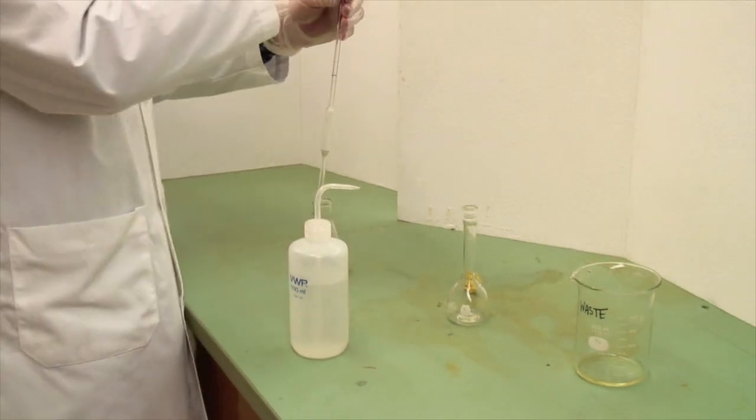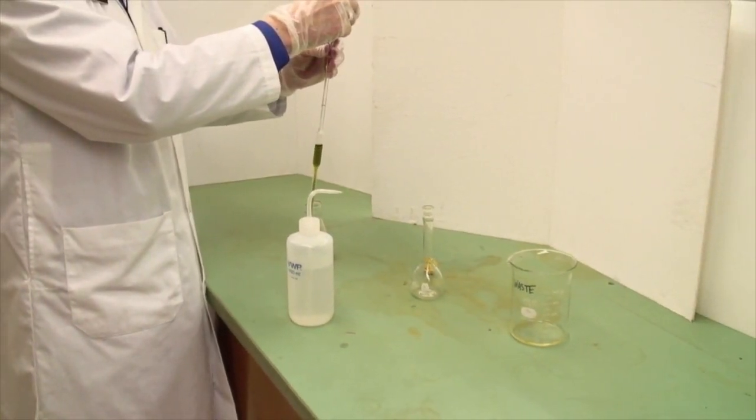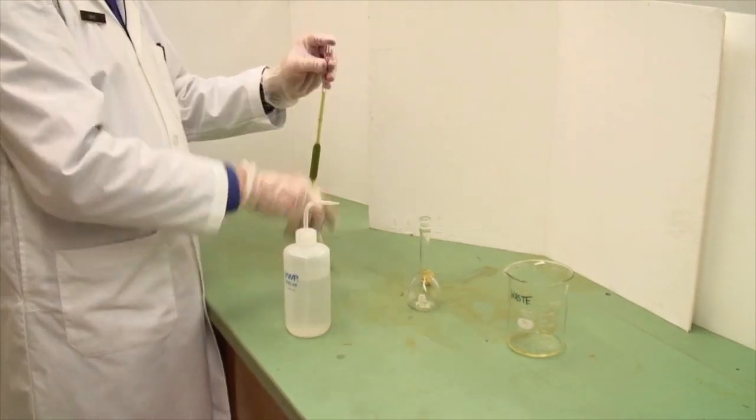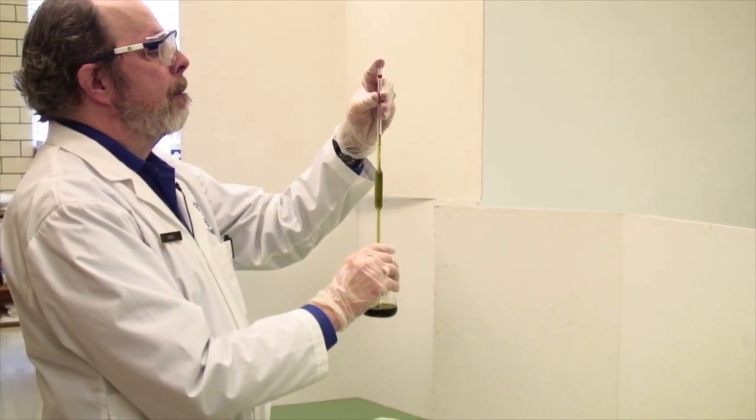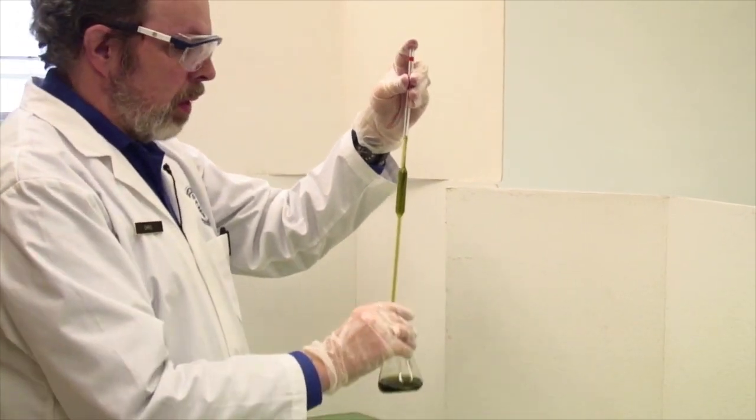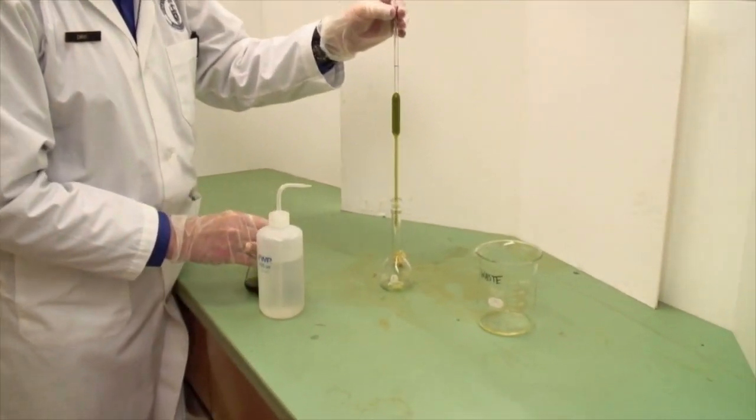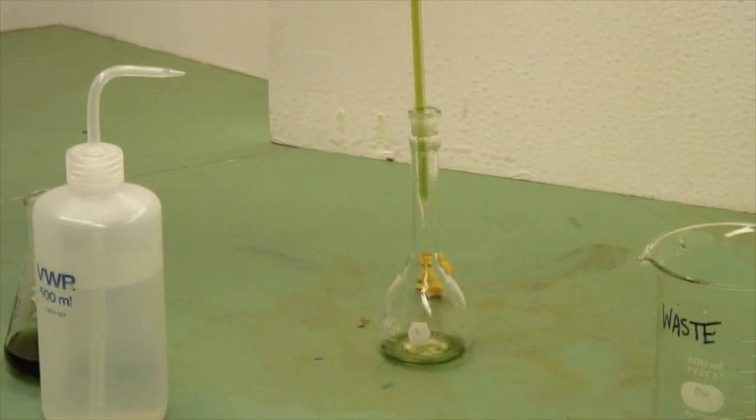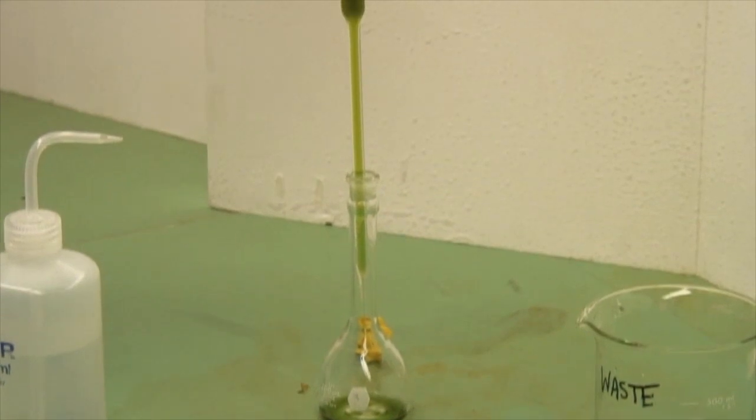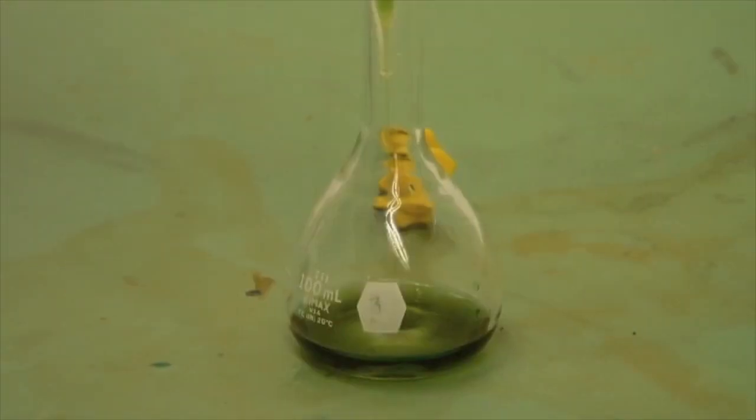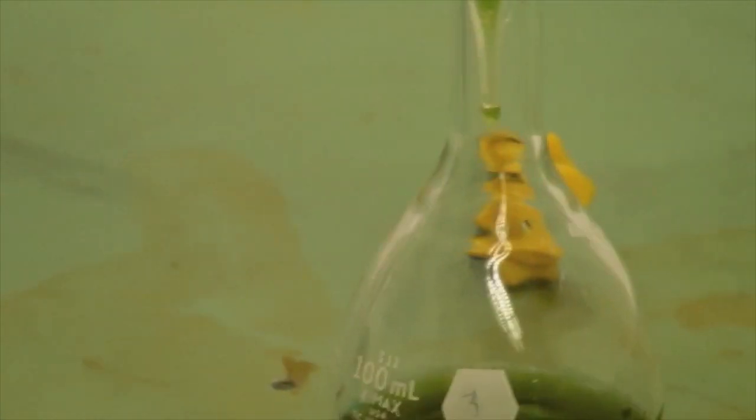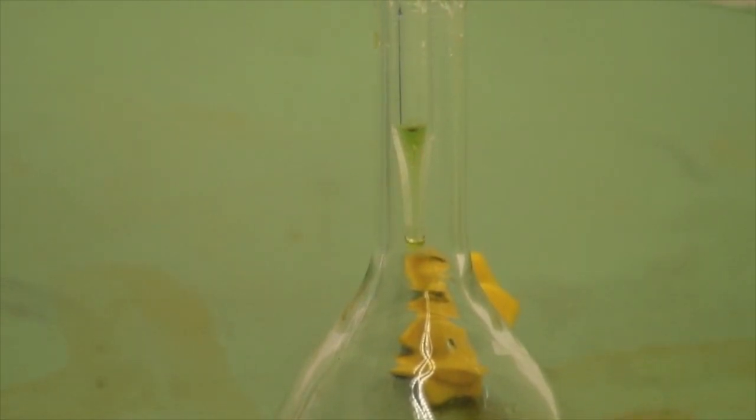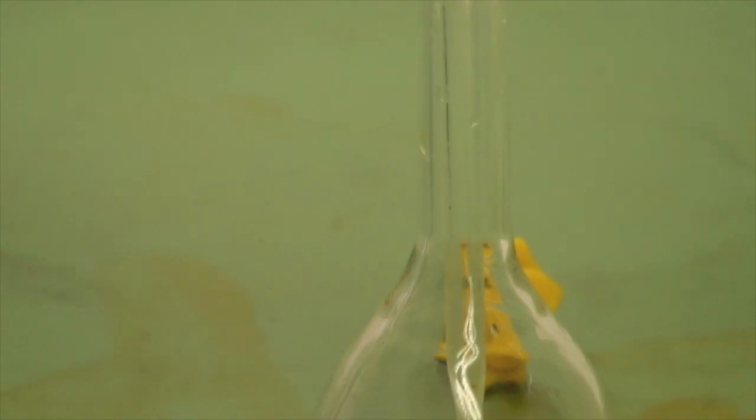Here I'm going to dispense 10 ml of a liquid into that flask. We allow this to dispense directly into the volumetric flask this time, and resist the temptation to use the bulb to speed the process up. Once it has stopped, and you've counted to 10, touch the tip of the pipette to release it.